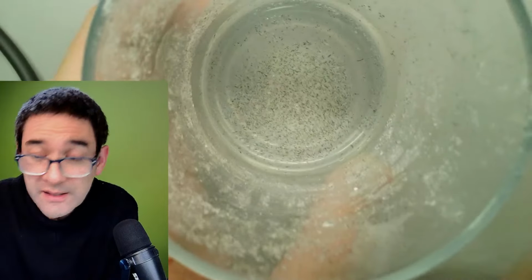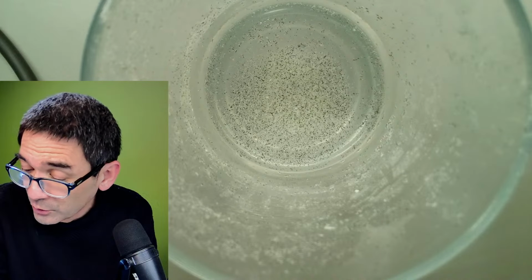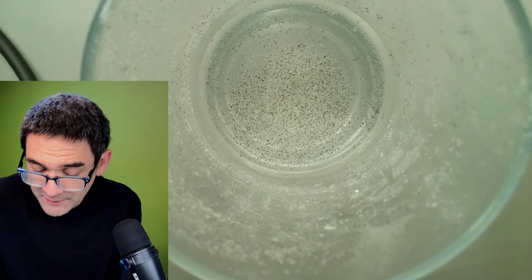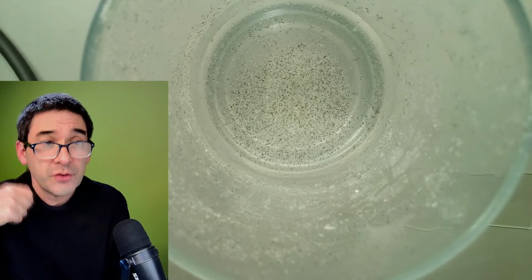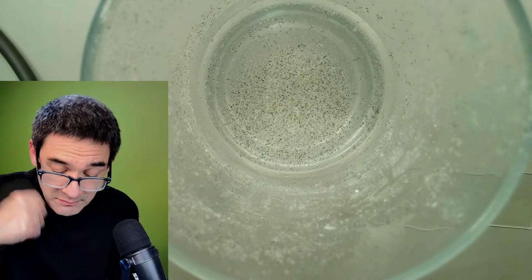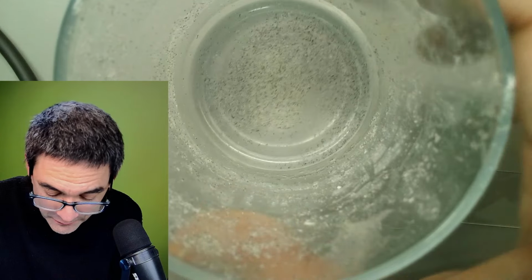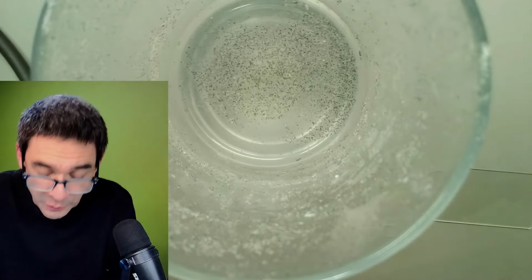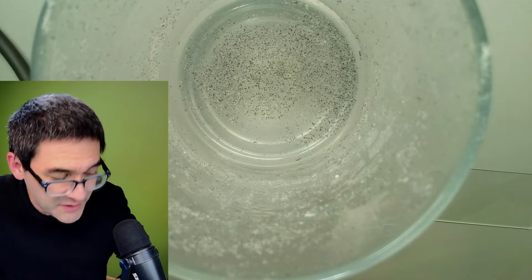So this is something I just also wanted to show you before I go, because I'm already talking over an hour, and there are a couple of questions still here. I was struggling a little bit with this. Shaving myself, dissolving the soap in water, and for whatever reason it didn't dissolve. It always starts to float upwards, right? So I have to get a small sample of this.